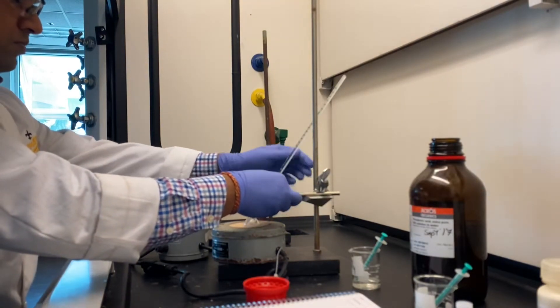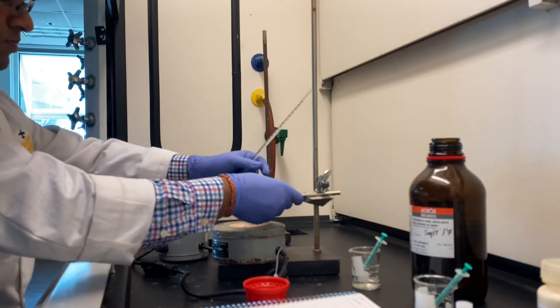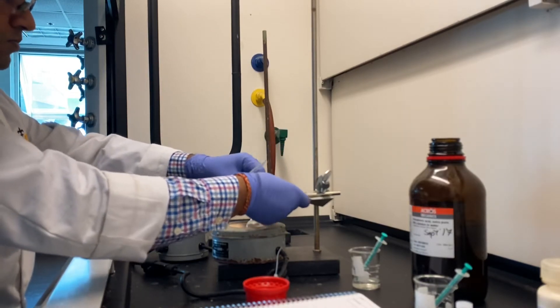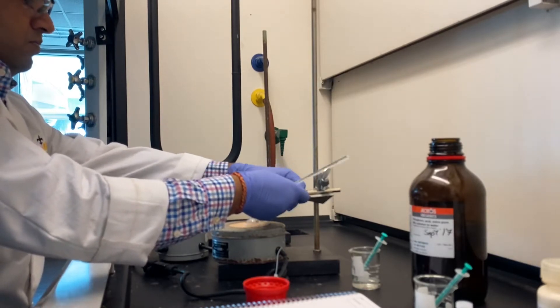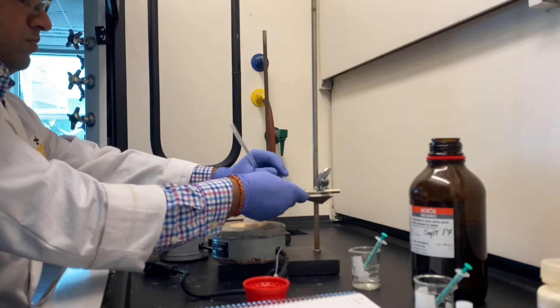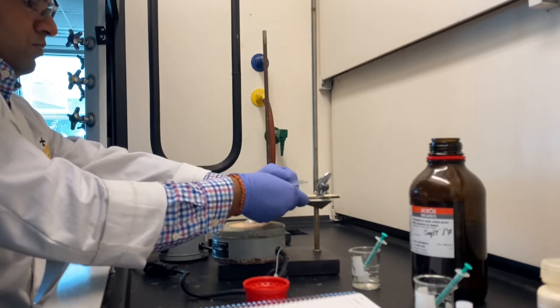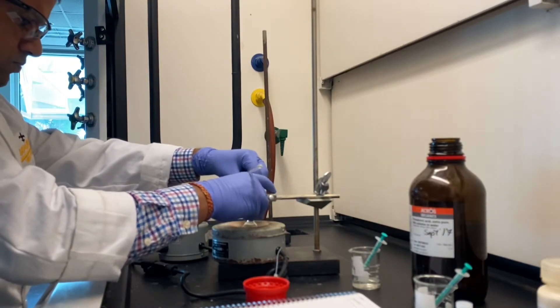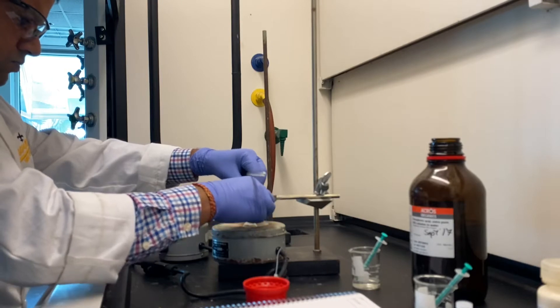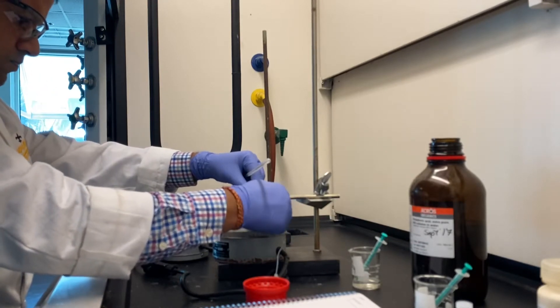While adjusting, try not to jam or break your thermometer. Always gently place it in the sand bath. It is very important that the temperature is around 140 to 150 degrees Celsius. 160 is also fine, but please make sure it does not pass 165 degrees Celsius.